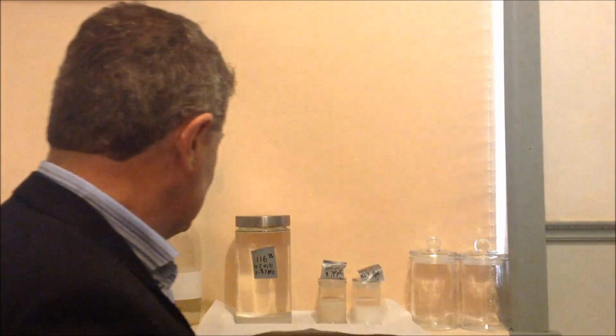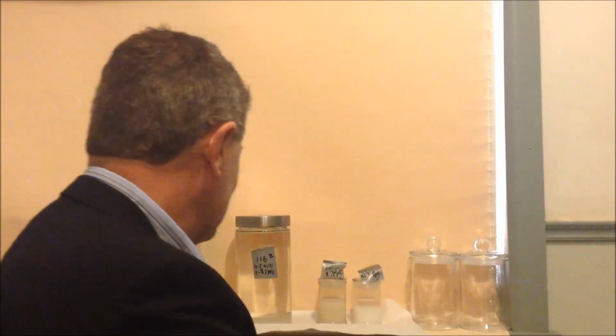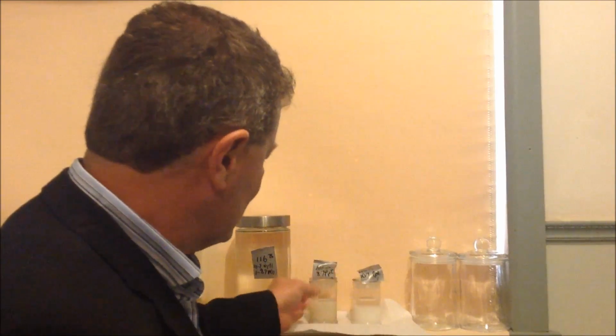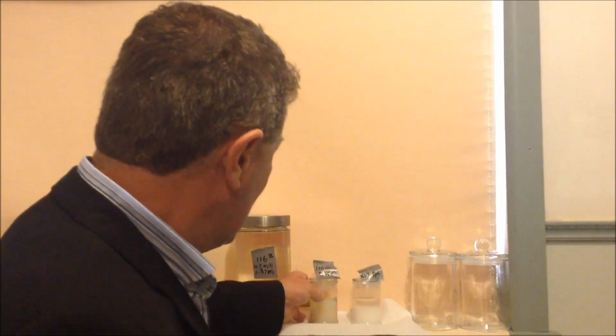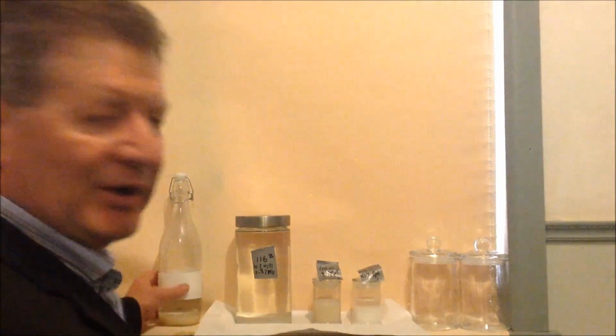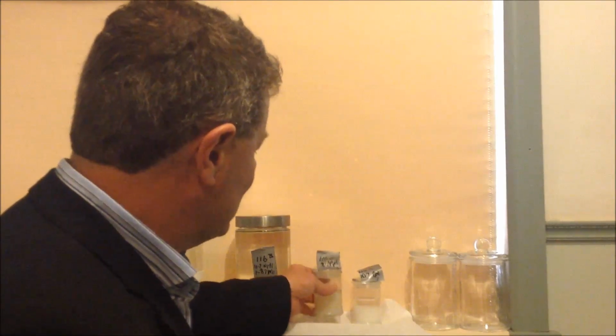And if you ever want to do this, take a sample, then you just need a longer piece of hose on your trusty syringe. After all, I won't lose this precious precipitate. This one's not much worth to me because there's only a very small amount of this precious material in it. So I'll be able to re-precipitate whatever happens, and it will go along with this one into my store, which will start to answer what this material is.